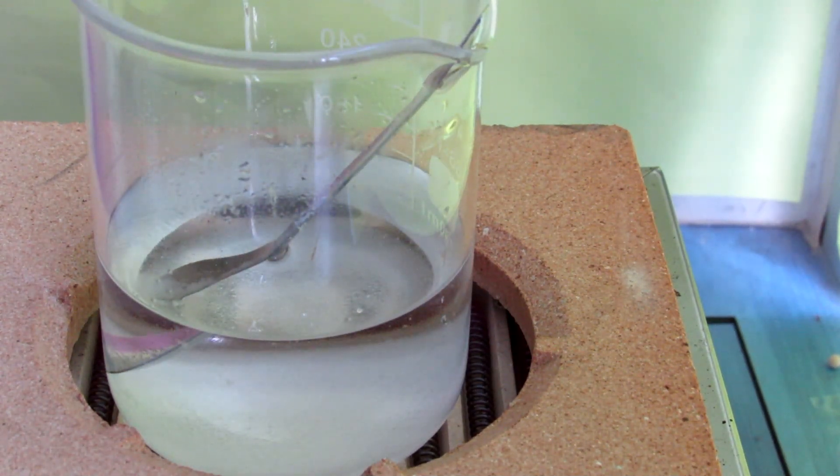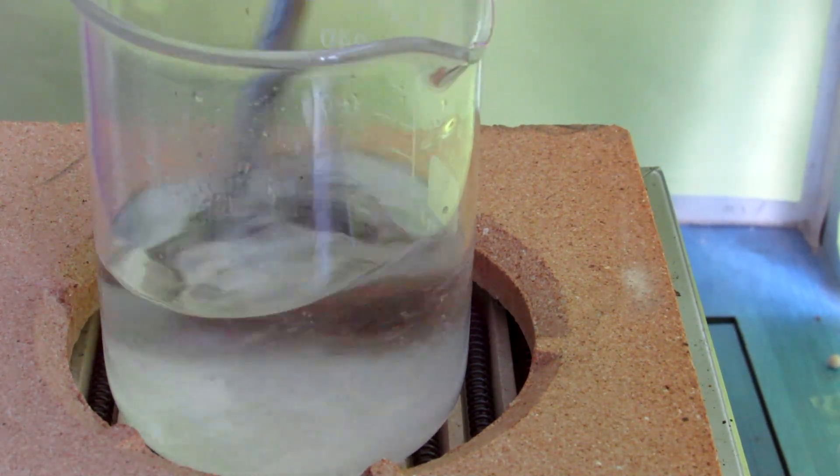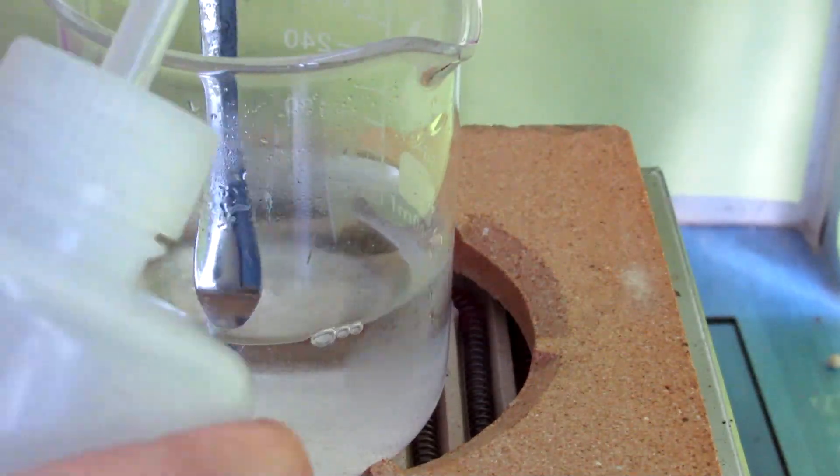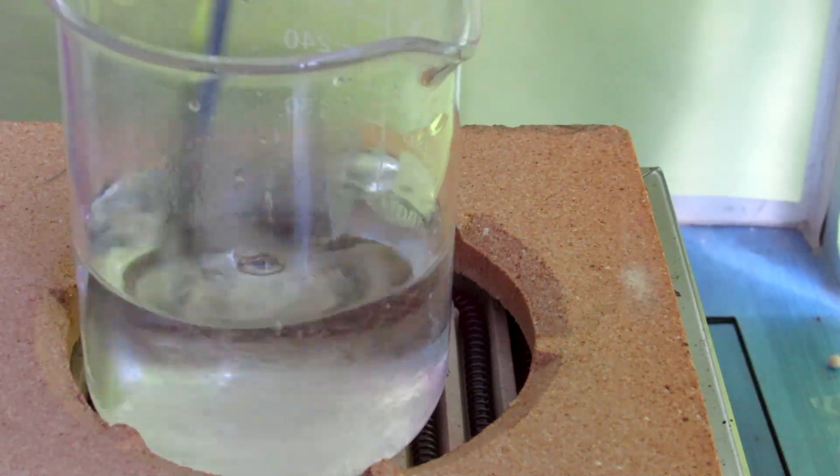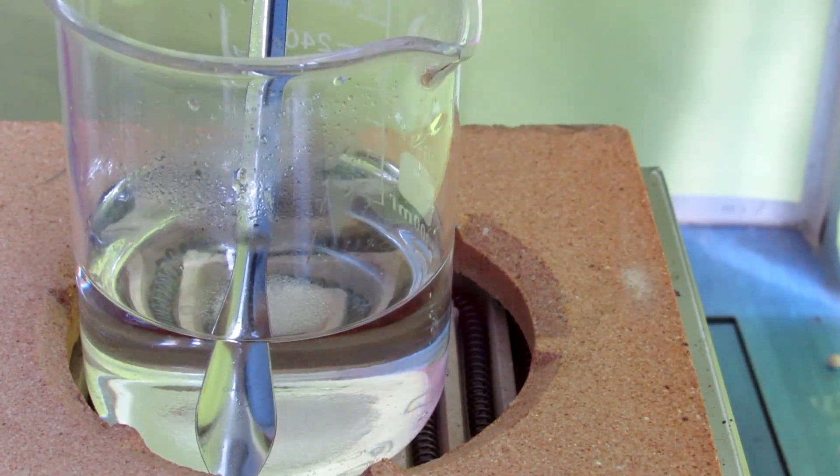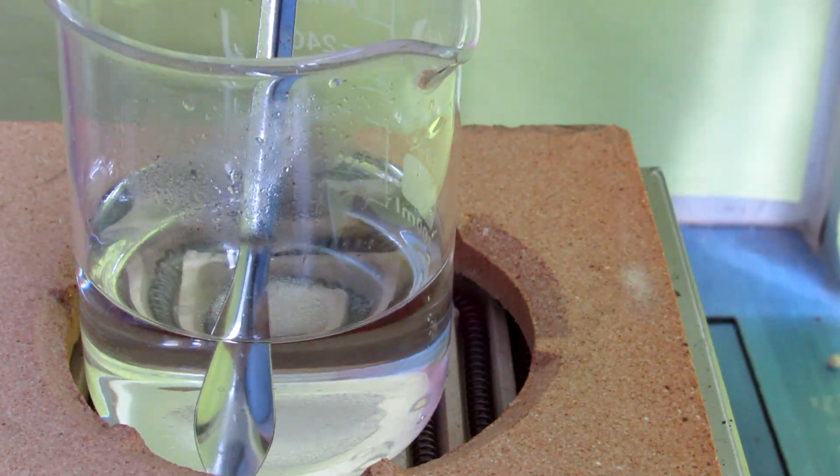I know little about copper-1 compounds, so I want to make some so that I can study their properties later. As I know really little about copper-1 compounds, the method I used might not be the most efficient one. Again, I'm just making it for fun.